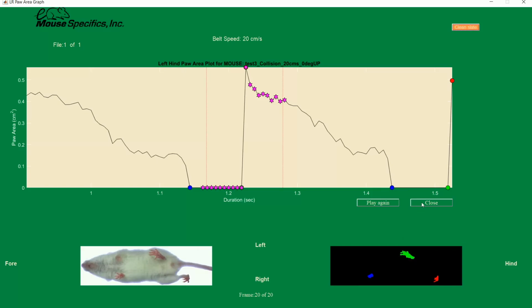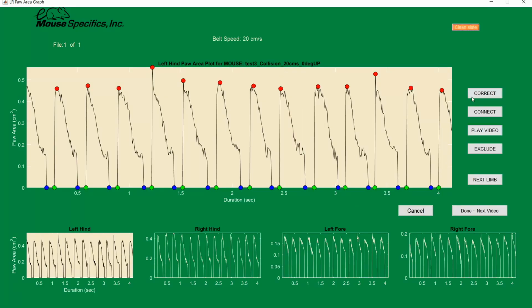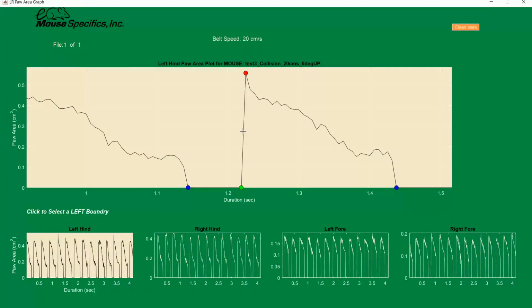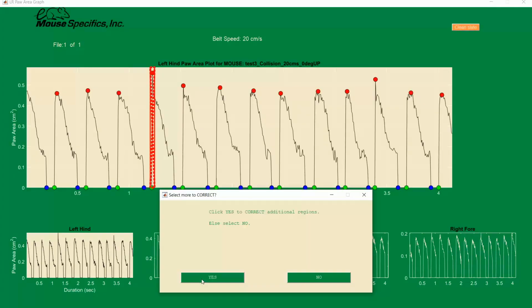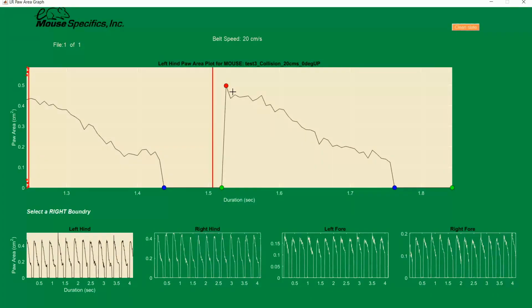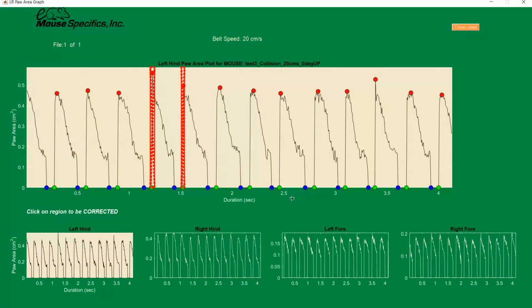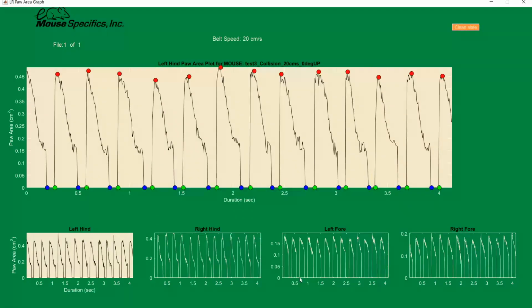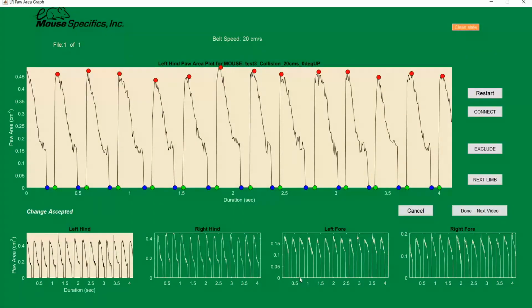To edit these, we're going to use the correct button again. This time we're going to click on the correct to begin, click once to zoom in on the area of interest, and then click once to the left of the green dot and once to the right of the red dot, highlighting the sharp peak in paw area. As with before, if there are more than one correct, you'll want to make all of them at the same time before clicking Done to finish. Using the correct, we are able to smooth out the collisions and get a more accurate reading on peak paw area.